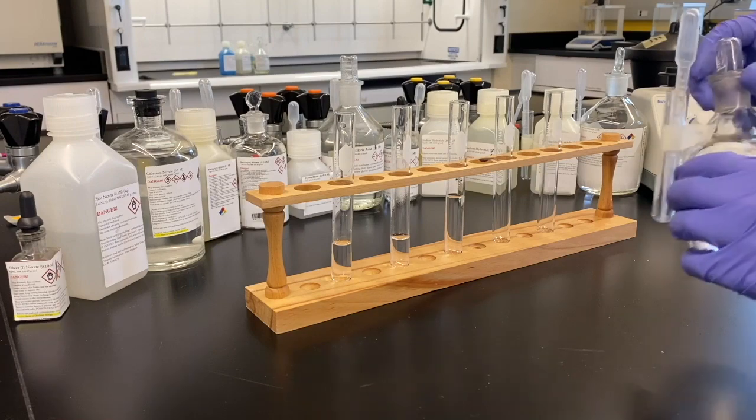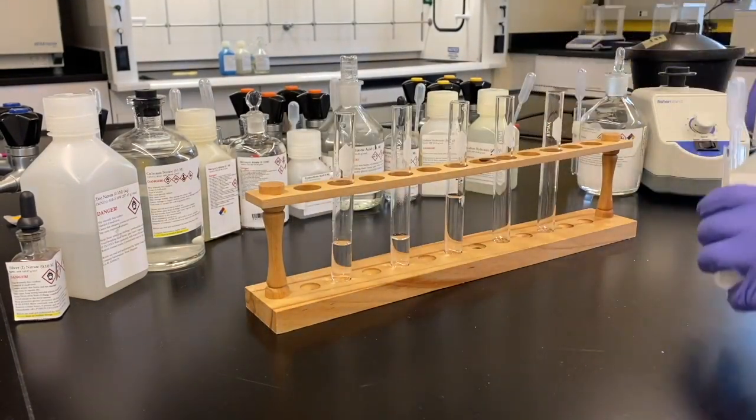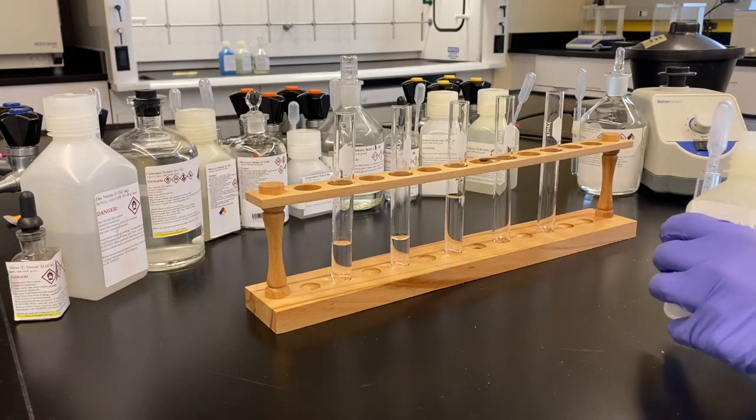I don't see a precipitate. Right, so we are placing cadmium on the right side of that final branch of our decision tree.